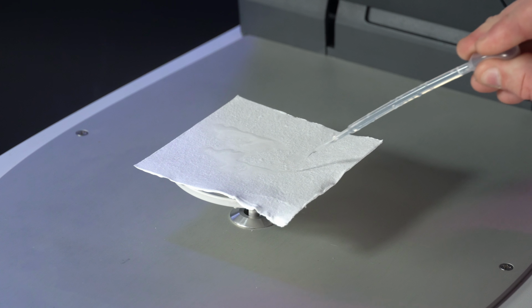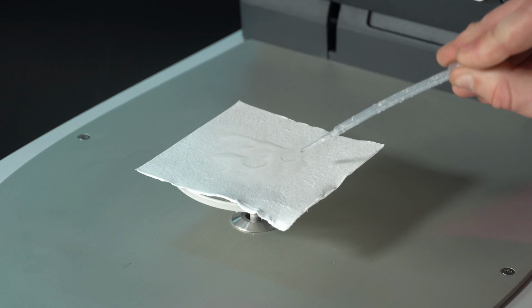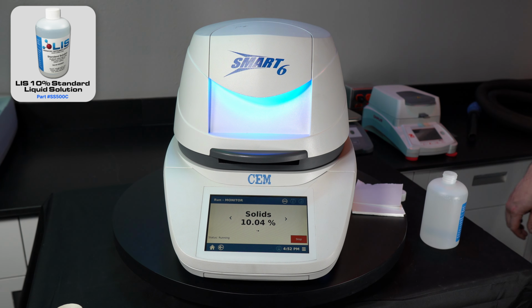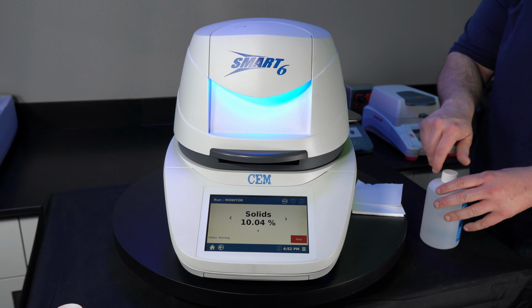Close the lid and run a few tests with our LIS standard solution. If there's no inconsistencies with these tests, run a normal sample test of your product. If there's no inconsistencies with the instrument, the issue is now resolved.